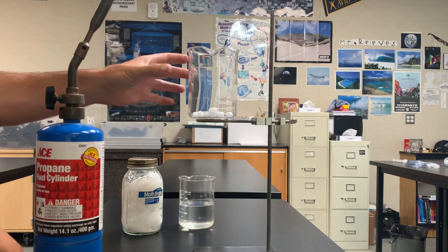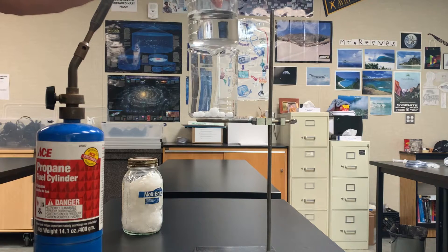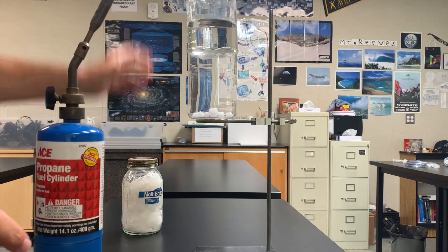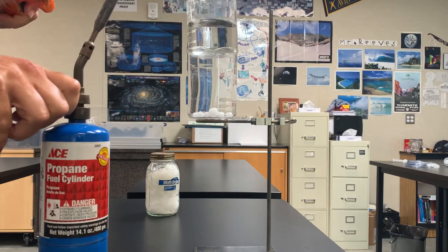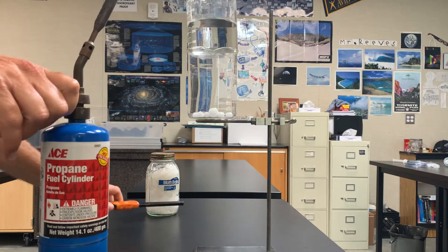And then this is a beaker, by the way. And then I'm going to put a beaker of cold water on top. And I'm then going to start my torch up and I am going to heat up that solid mothballs and I'm going to melt it.